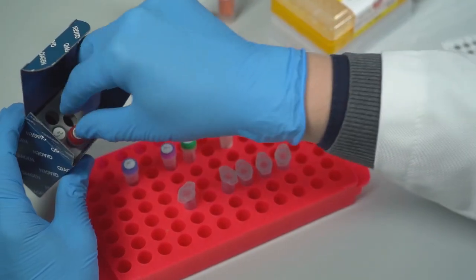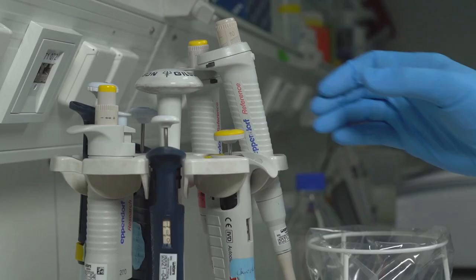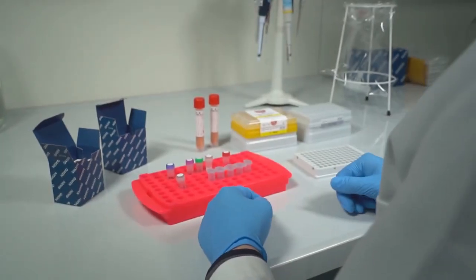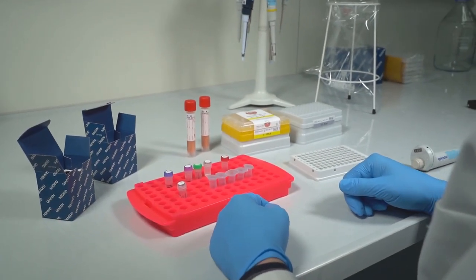Prepare a reaction mix containing master mix, primers and probes for your target and the controls. You can also use your own primers and probes for the assay.